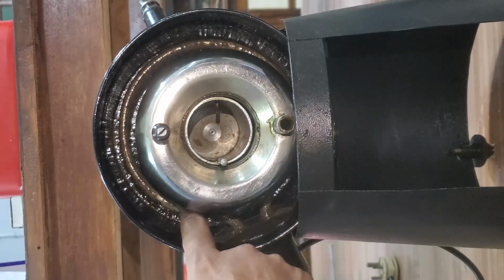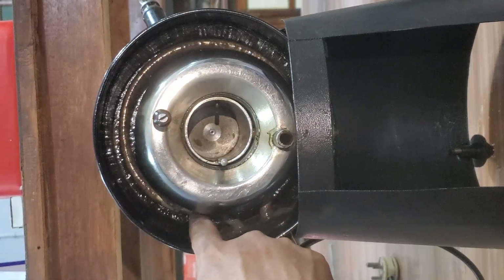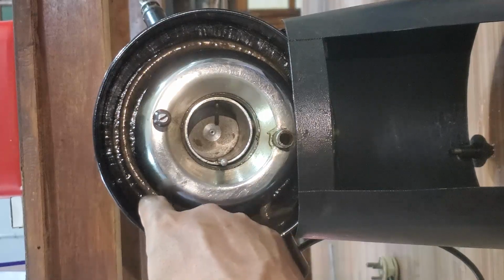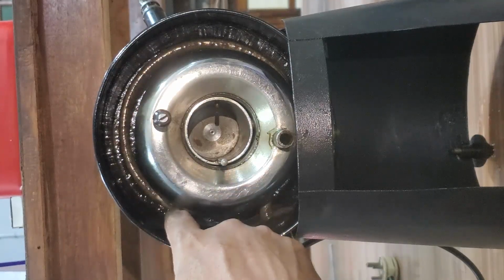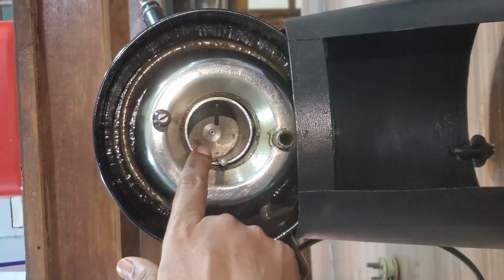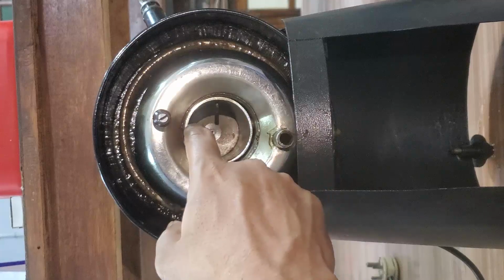For that we have to heat the oil also. To attain the temperature we need a heater. For the heater, this is the coil. So we will pour the water also above this level, and slowly the water will be heated up. That heat will be transferred to this oil, which we are going to pour into this cup.